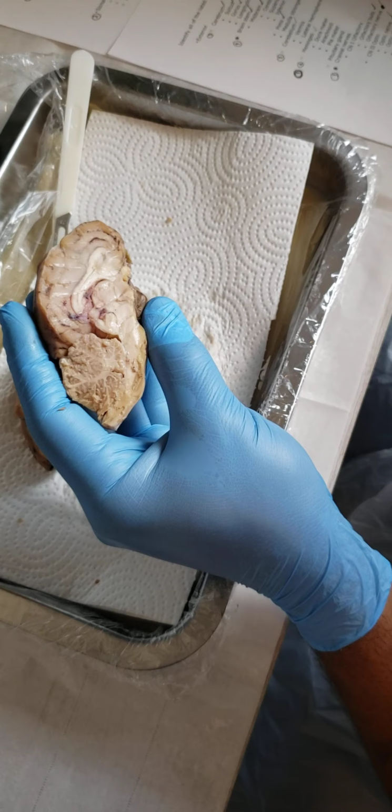The optic nerve came apart a little bit, but it kind of makes an X. So here it's actually the right side of the brain, the right hemisphere. Right here, and then it would cross over, and that's where this piece right here goes. Here's your optic nerve right there. So two optic nerves.